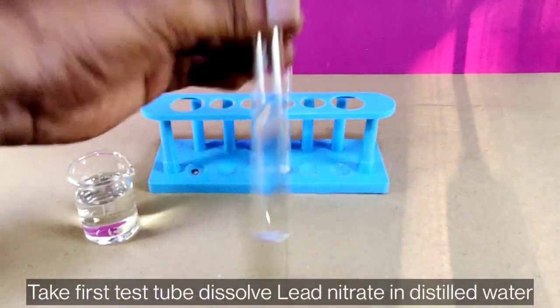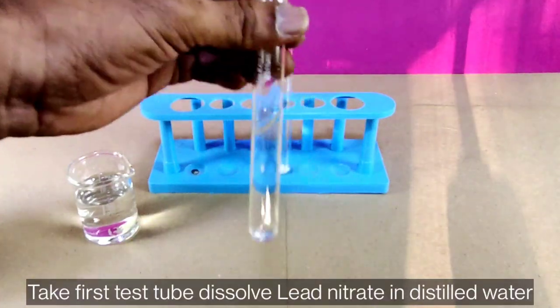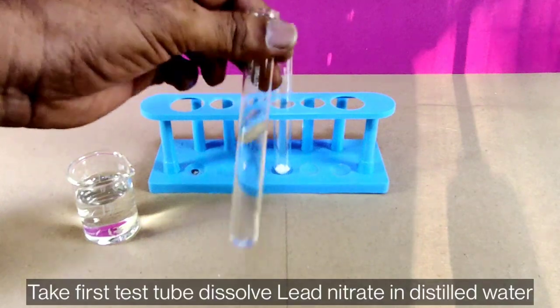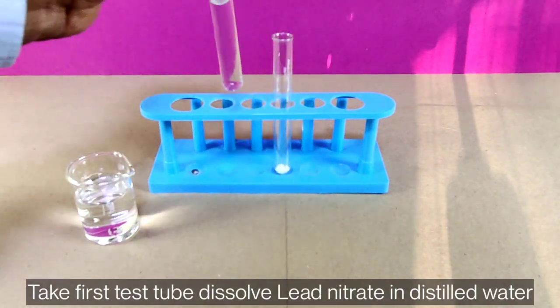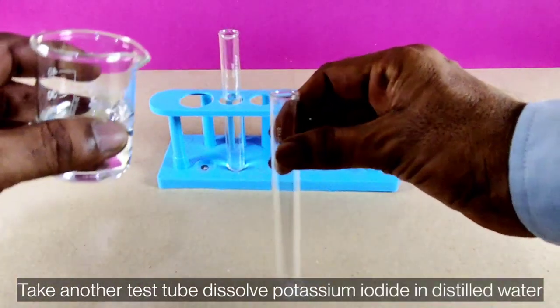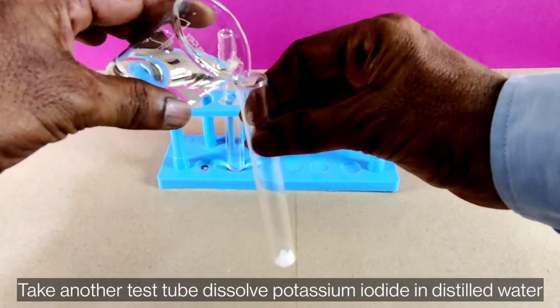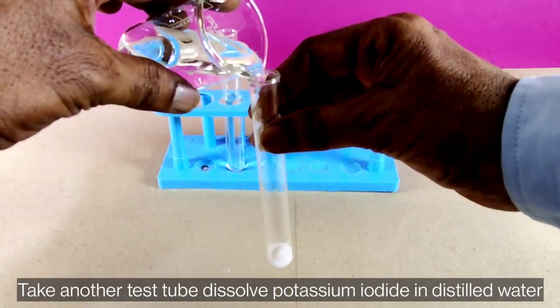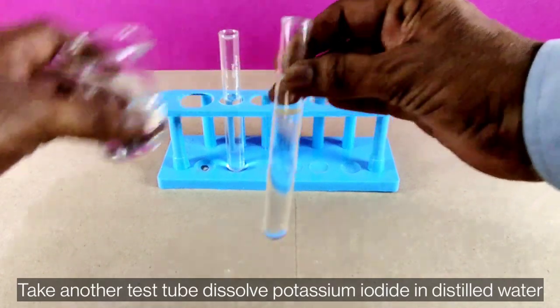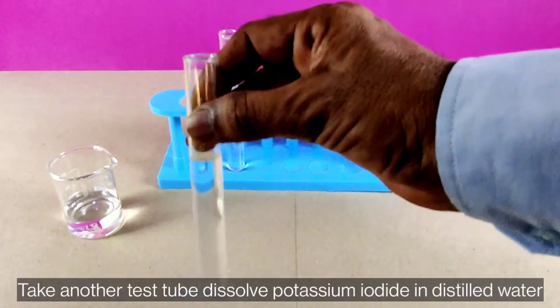Shake well until the chemical is dissolved in the test tube. Take another test tube and dissolve potassium iodide in distilled water. Shake that test tube as well.